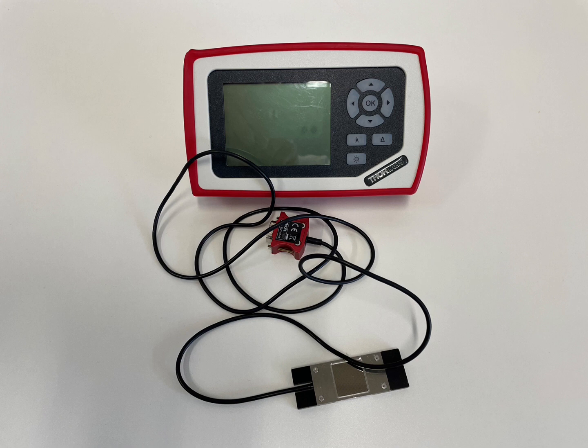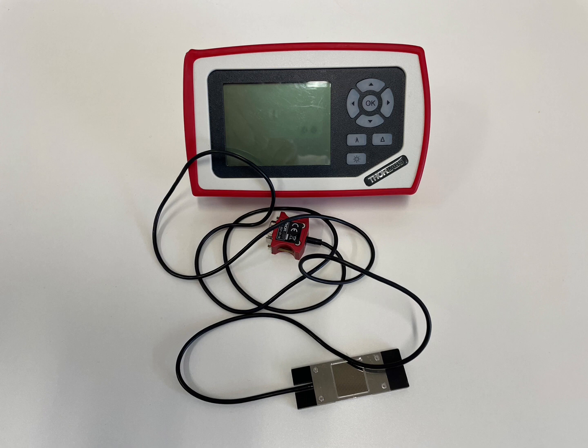This powermeter model has a rechargeable battery and can be used without any power cable. Make sure the battery is well loaded, especially before starting a long-term stability measurement.